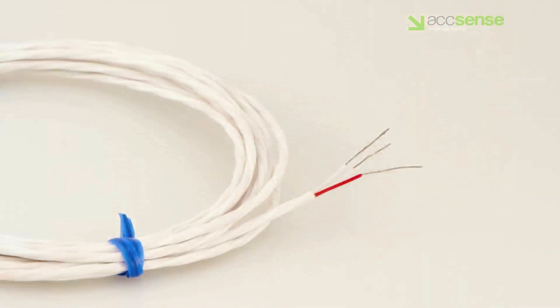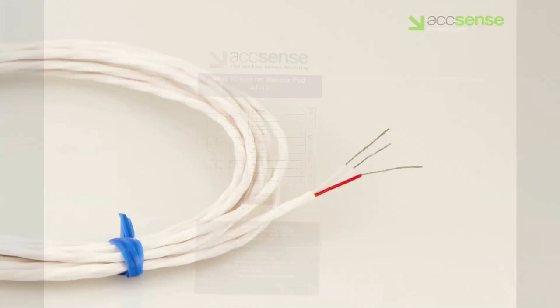It has three wires for connection to the A113: two of one color and one of a different color. Most commonly there are two whites and a red.